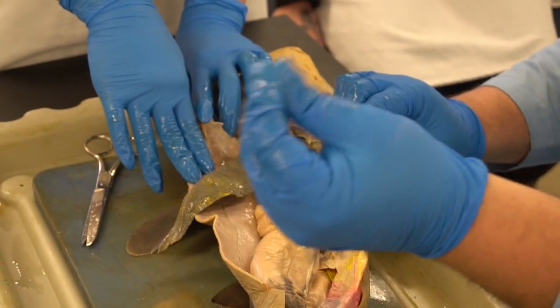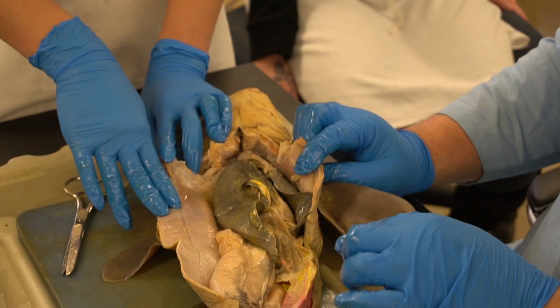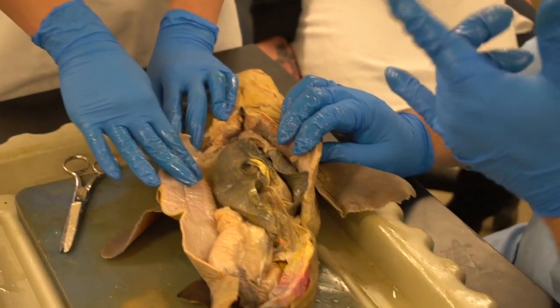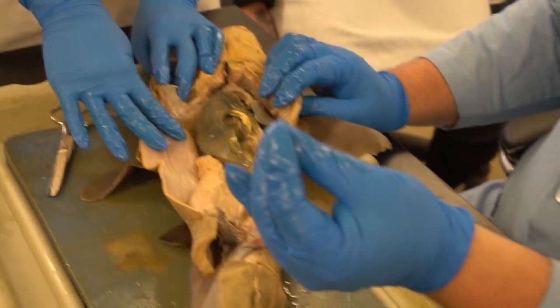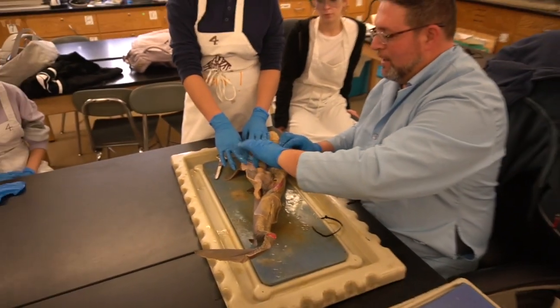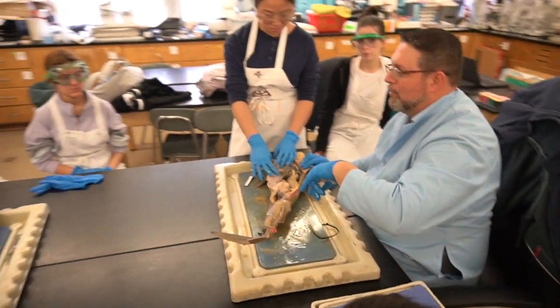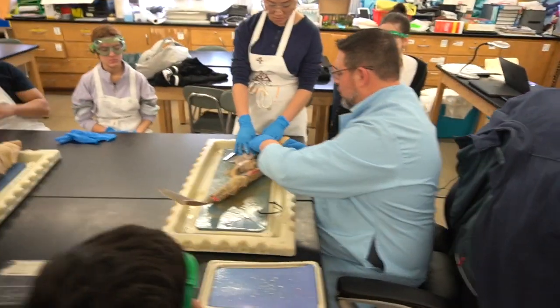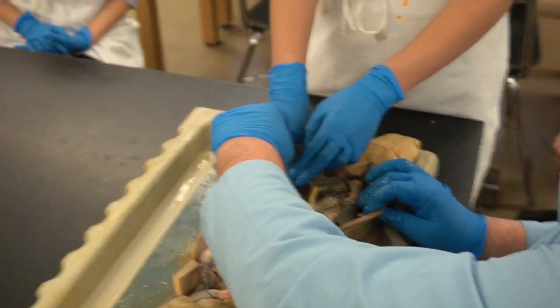Okay, it's very greasy, very oily. All right, the liver makes a lot of enzymes, one of which is called bile. It's actually a salt, and it is very, very greasy. Okay, so be mindful when you go inside and view that. If this gets down on the tabletop, it's gonna be really, really greasy. We have to use a degreaser to get it off. It's pretty intense.